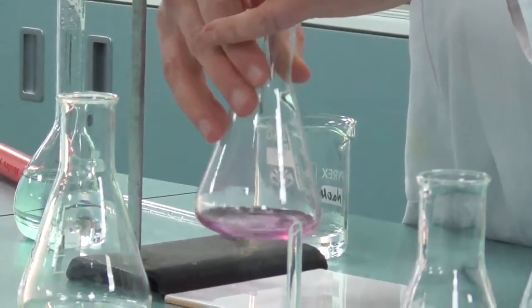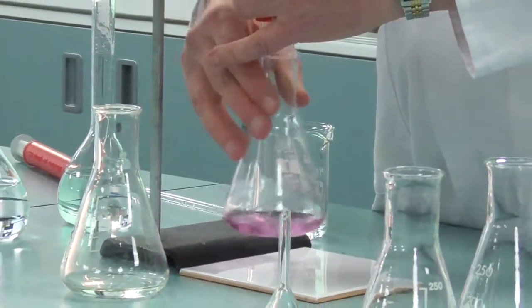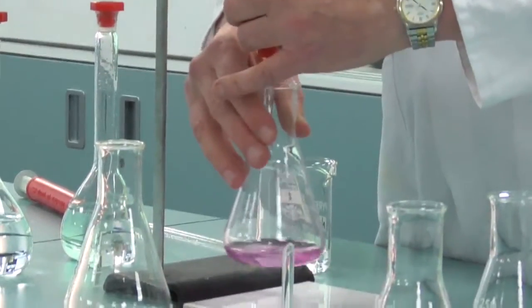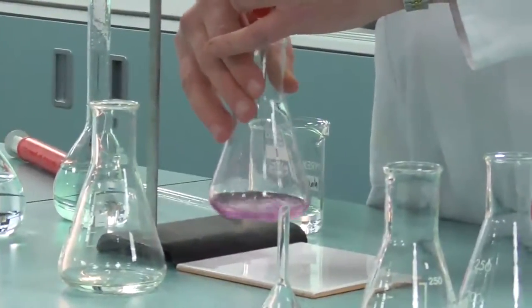This time I am going to look at the volume in the burette because I'm going to stop it after I've run in about nine centimeter cubed.